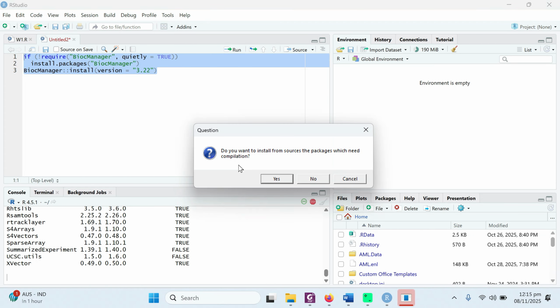Sometimes you can see a message like this: do you want to install from source packages which need compilation? You need to click the yes button. Every time a message pops up, you need to click on the yes button, which means it is going to install all the required packages which you will need to perform the analysis on the sequences. Meanwhile, while it is installing the packages, you will see the red button over here. It means that it is still working and installing all the packages.